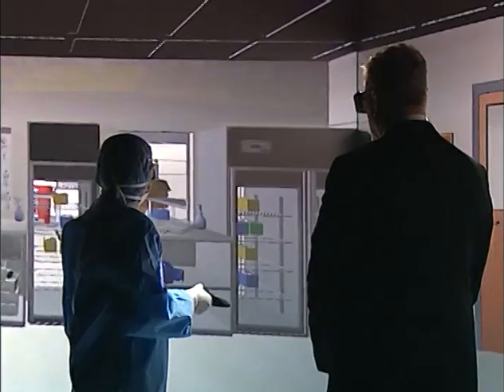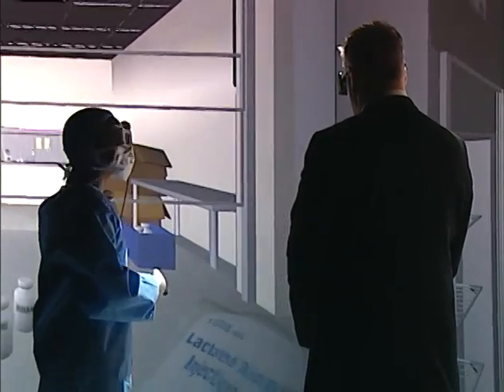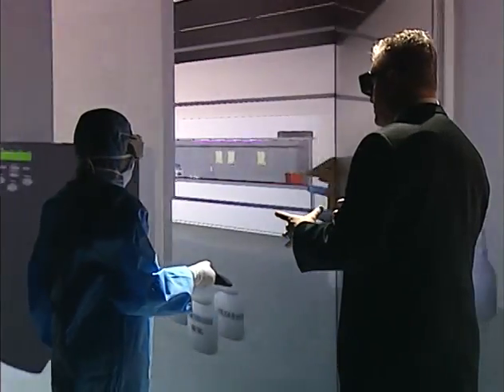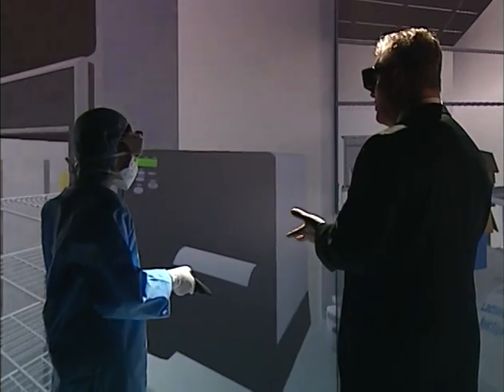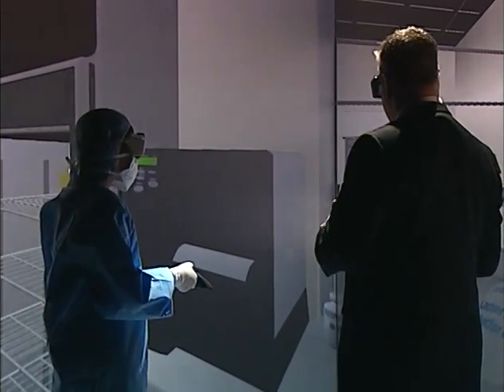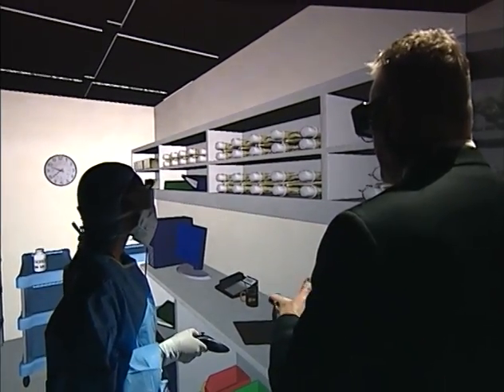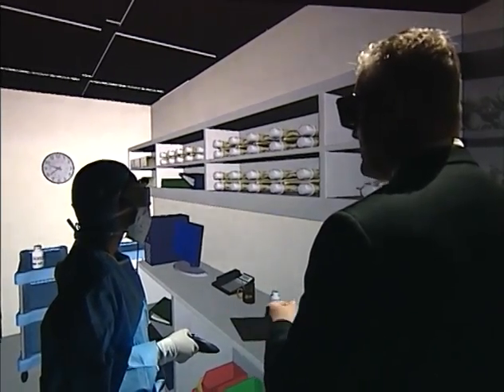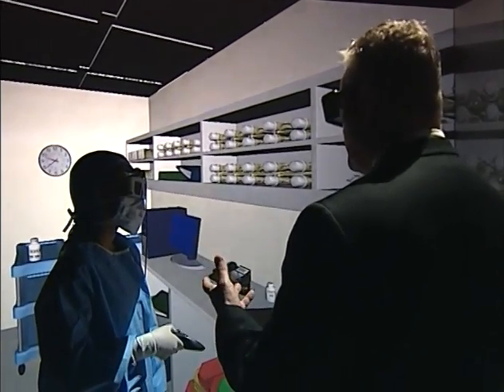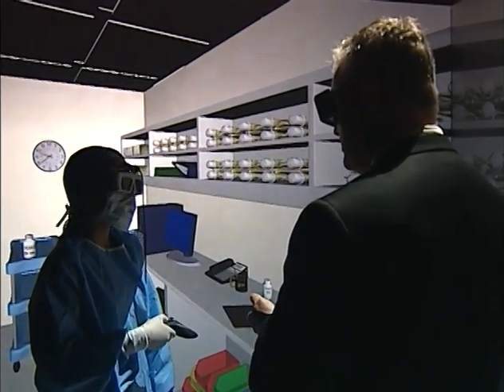So in terms of this large volume, what I really want you to pay attention to is that when you're looking at a large volume parenteral bag, they all look basically the same, and the print is very small and very similar. So it's incredibly important that you pay attention to the drug and the diluent, but the seal isn't broken, and so the product isn't mixed. And then when the product is sent to the patient care unit, the nurse is required to break the seal and mix the product together before the drug is administered to the patient.